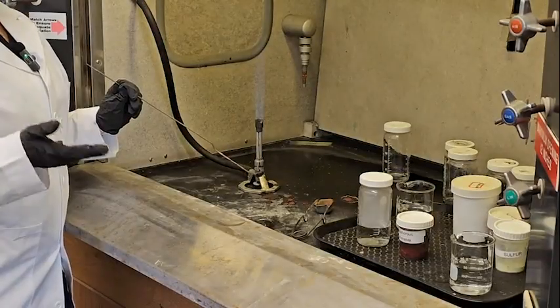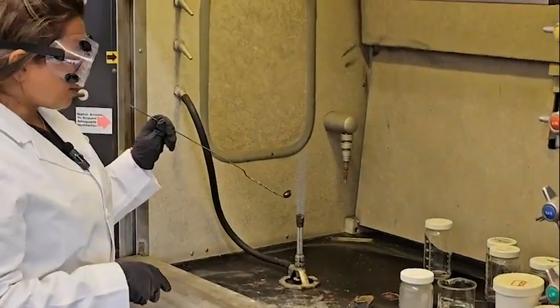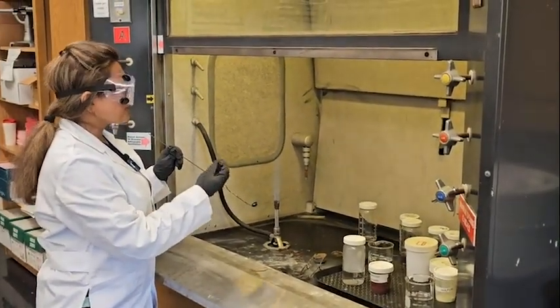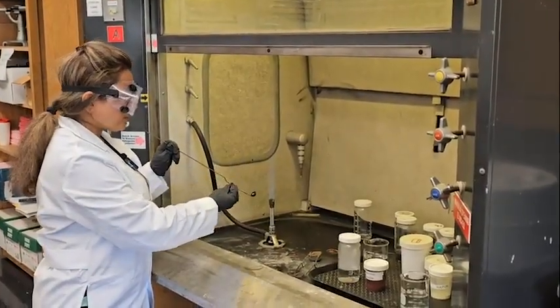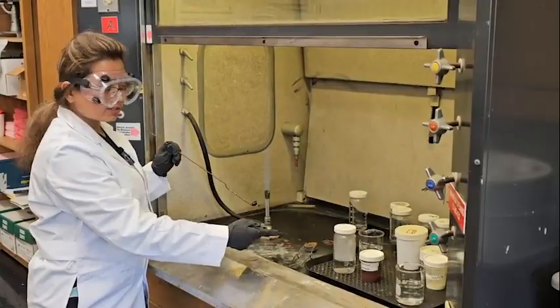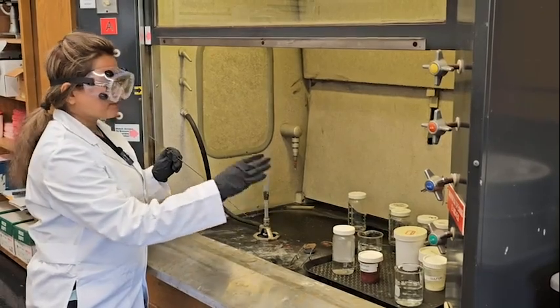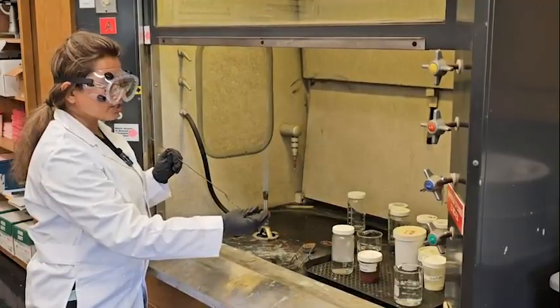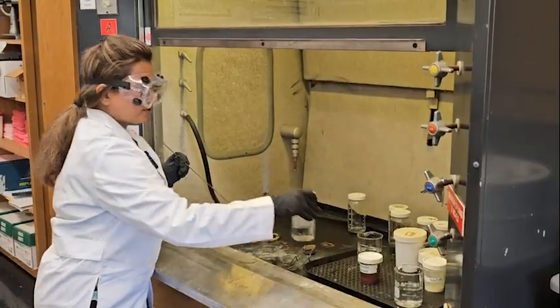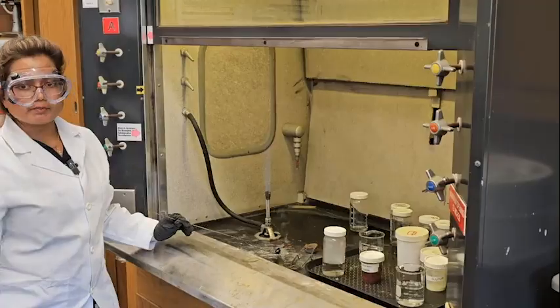I'm not going to show you all of them. You can do it by yourself. It's the same process. Take the element in the spoon and burn it here. Make sure you see the color changes. In the air, what's the color of the flame? And when it contacts the oxygen, what kind of flame does it produce? After the element contacts the oxygen, you get the oxide. Let it stay, because this oxide will react with the water, and we are going to use this water for the pH test.